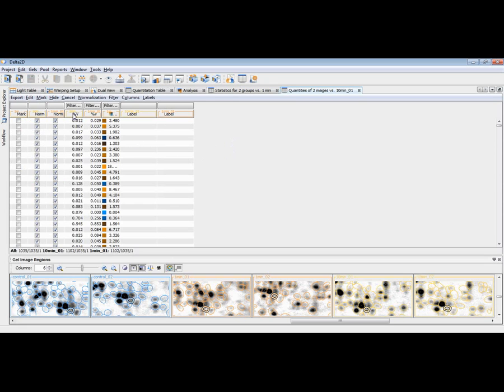Yeah, and changing the visibility, as I mentioned, you can choose this eye symbol to control the visibility in a very easy way, or you just click on columns in any table. You can do that to then check or uncheck certain columns for the different images that are involved in this view. Tables always allow for exporting them to Excel or to a character separated value format. You can also export pick lists, of course.